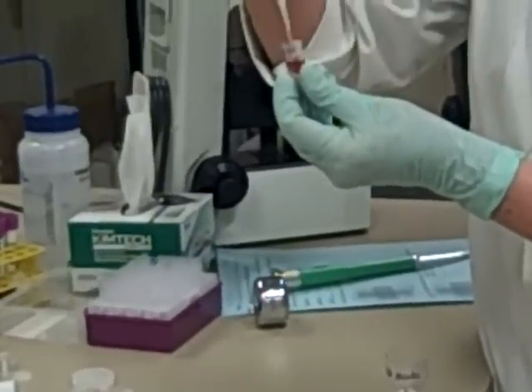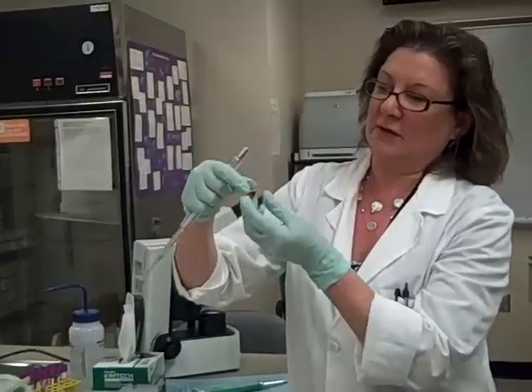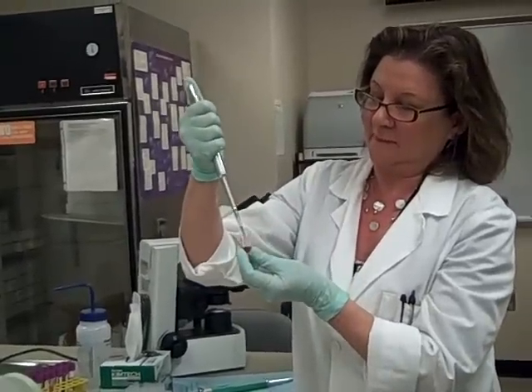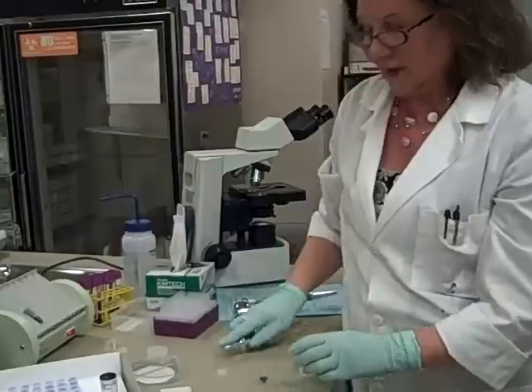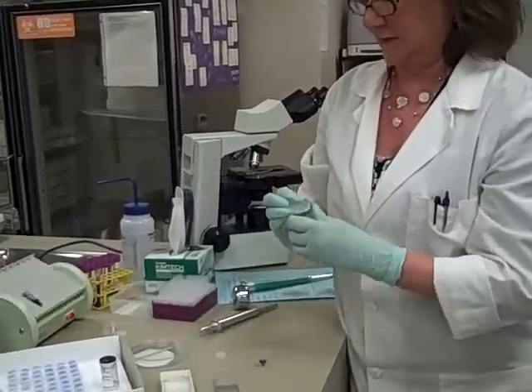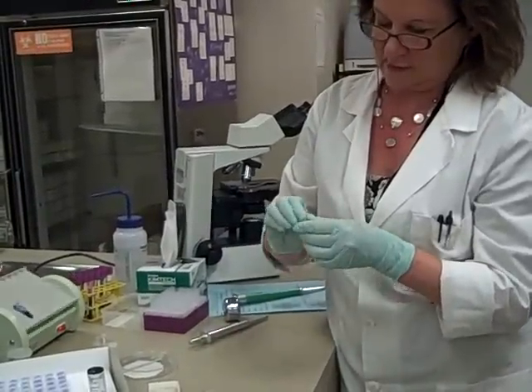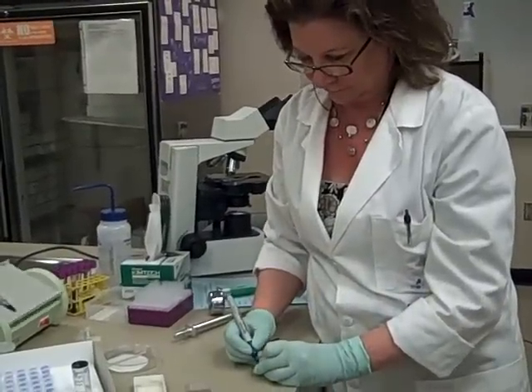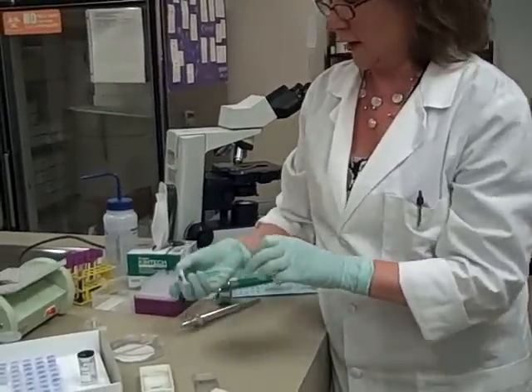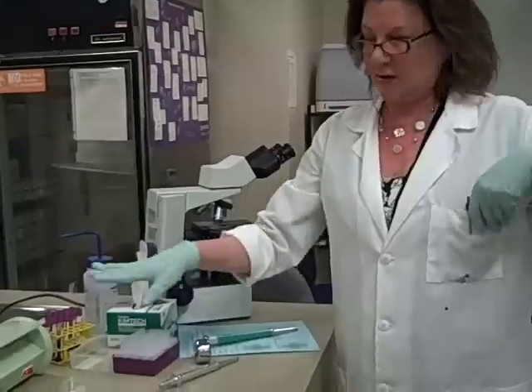You can use your little pipette tip to mix. See how it's kind of clear red right now? We want that to turn kind of a brownish, cloudy color as it sits. That's because of the release of the hemoglobin. It's already turning. We can put our little top on it and label it. We'll let that sit for 10 minutes too. Those are good for about four hours.